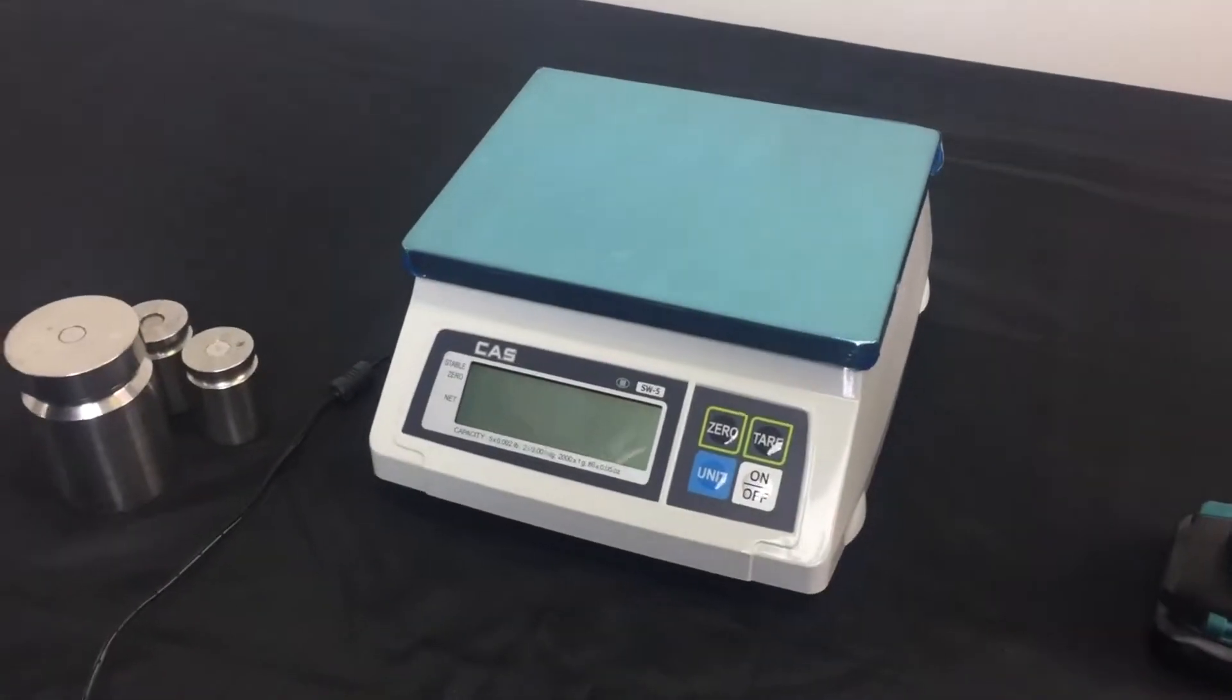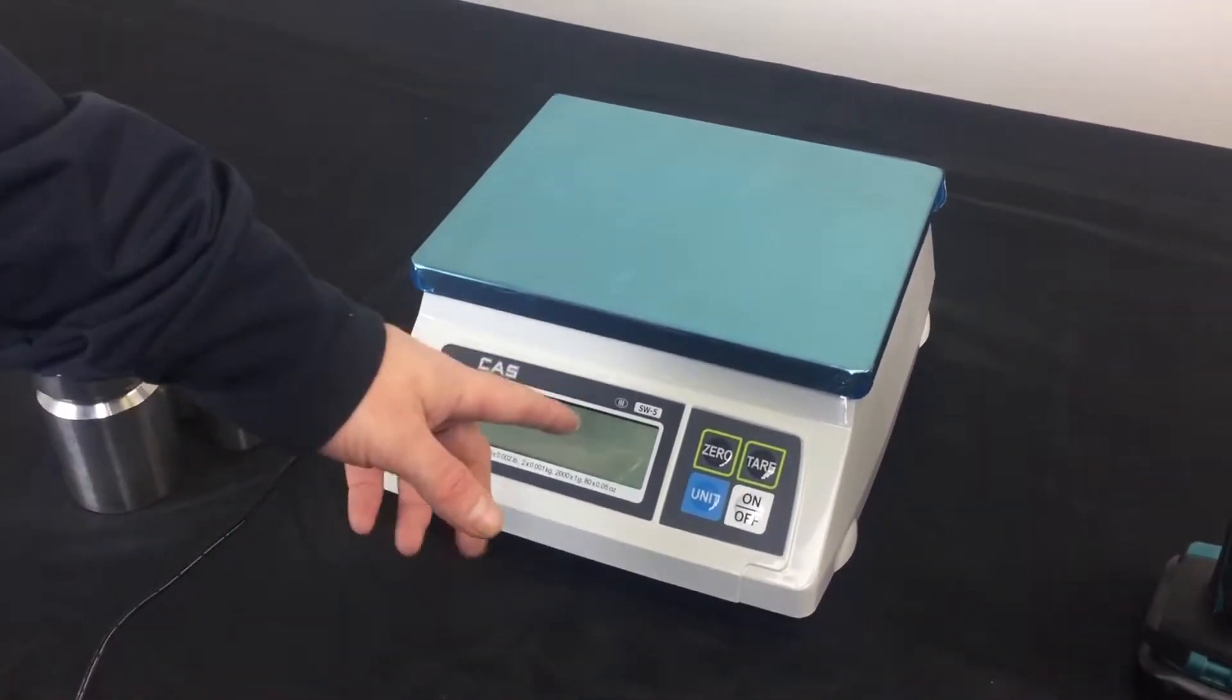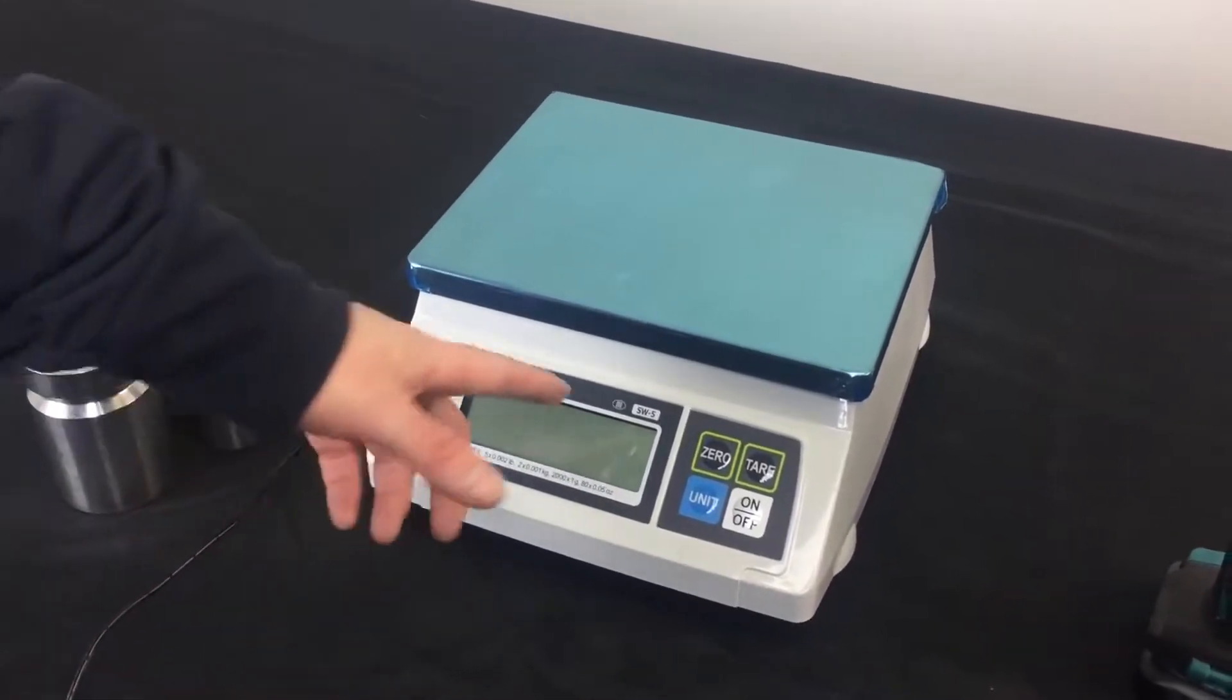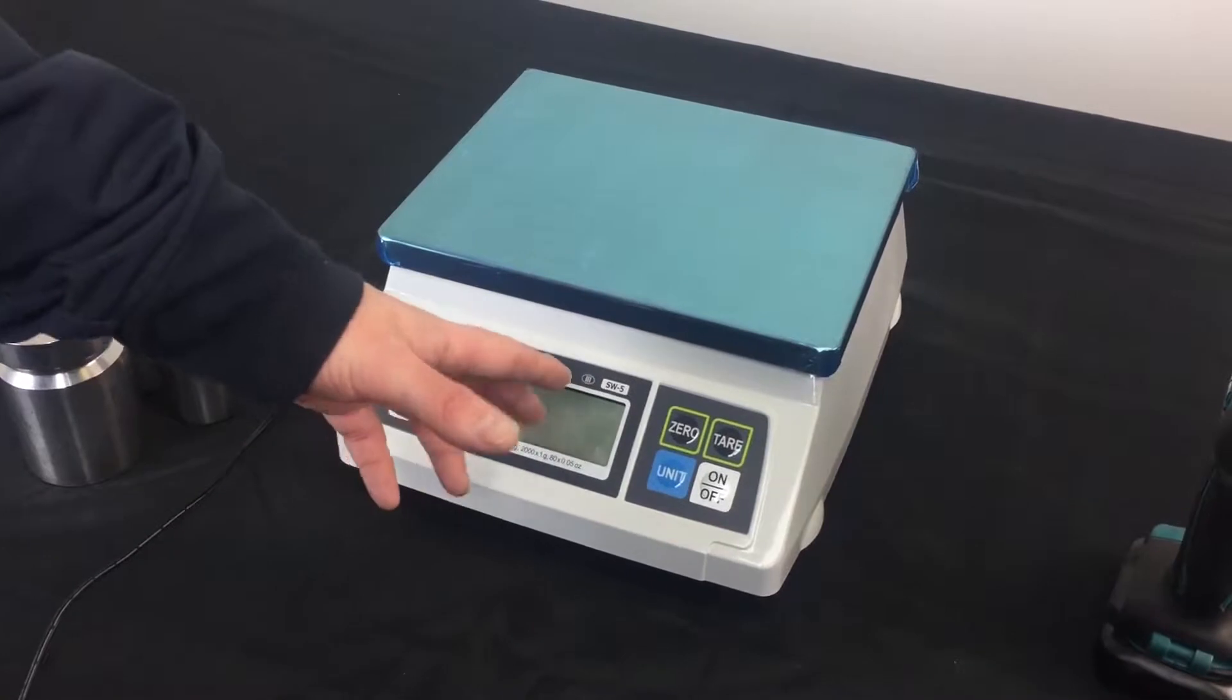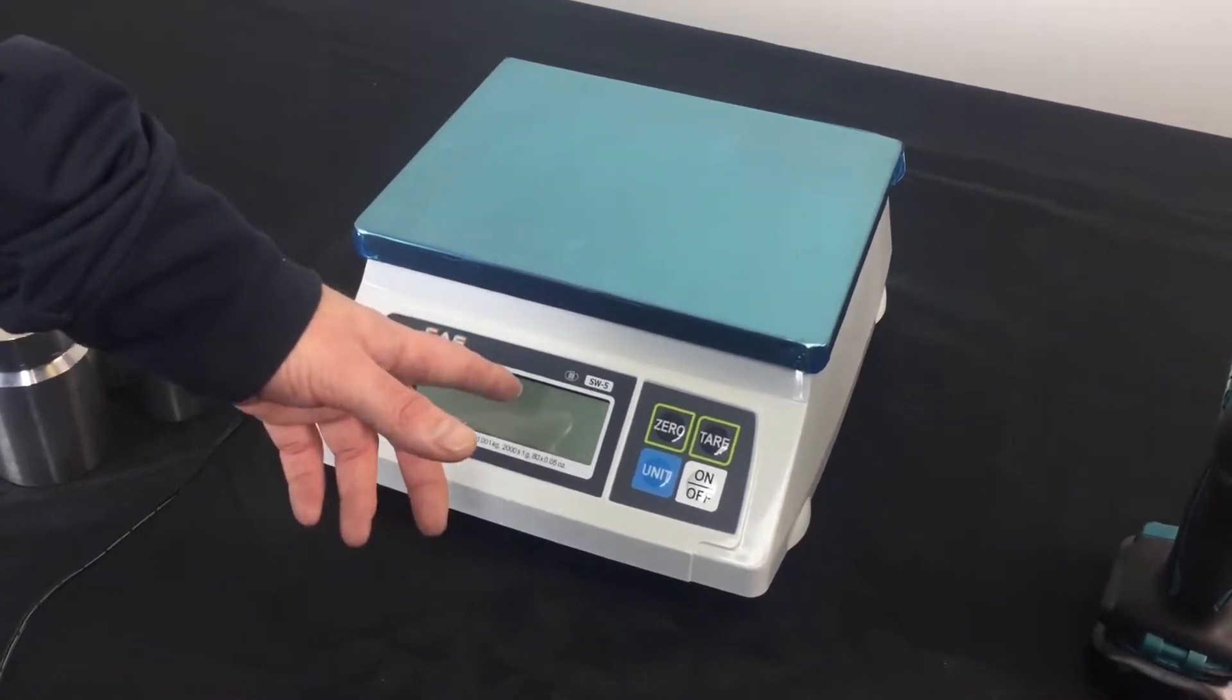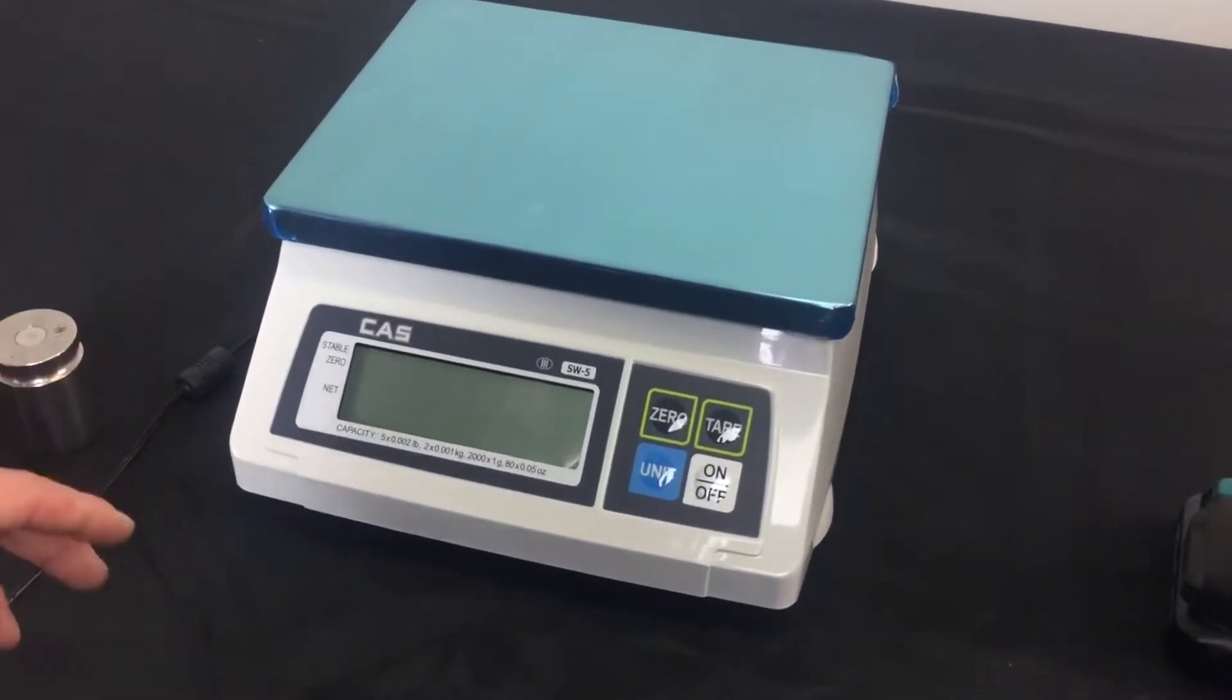This video today is to show you the calibration procedure for the SW series. I'm going to be using an SW5. When you're calibrating, make sure that you do look for the proper capacity of your scale and know what actual scale you're working with.